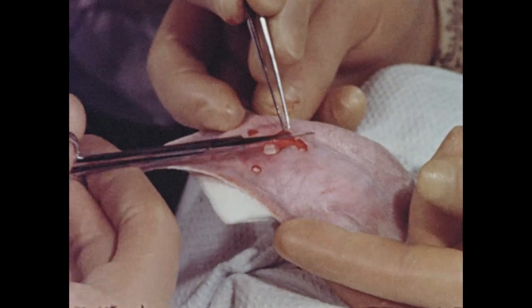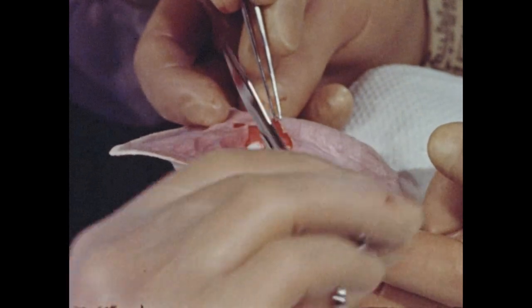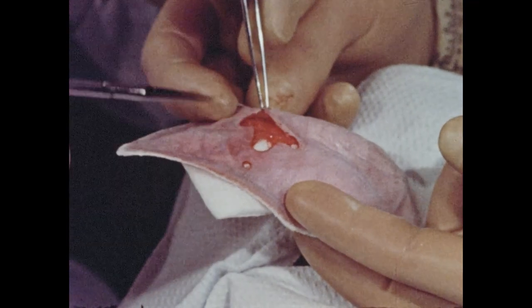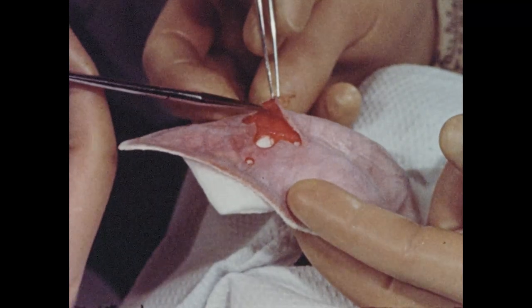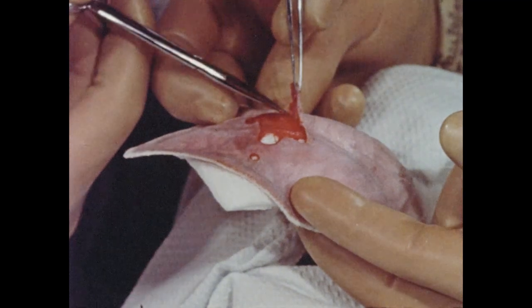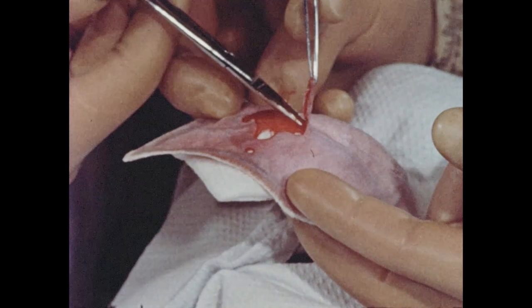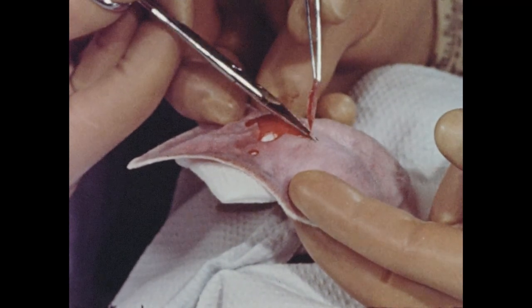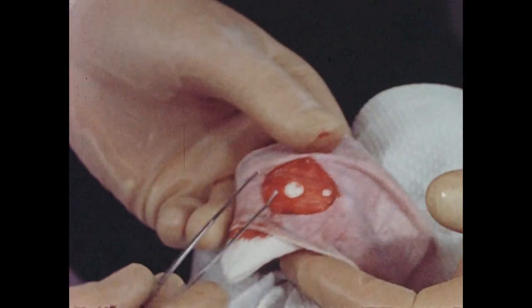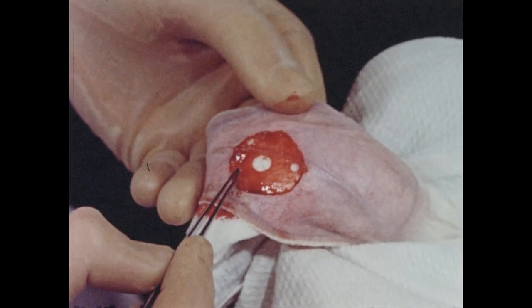The skin is then removed from the outer surface of the ear. Special care should be taken not to injure the exposed blood vessels and cartilage. Upon completion of this stage, a circular area of skin measuring about 30 millimeters in diameter, or approximately 2 millimeters larger than the base plate, will have been removed from both the outer and inner surfaces of the ear. The central artery and vein, as well as several of their smaller branches, have been preserved.